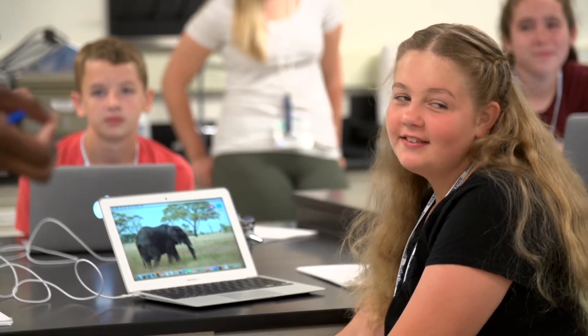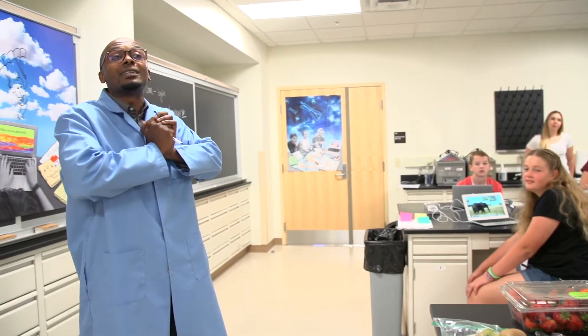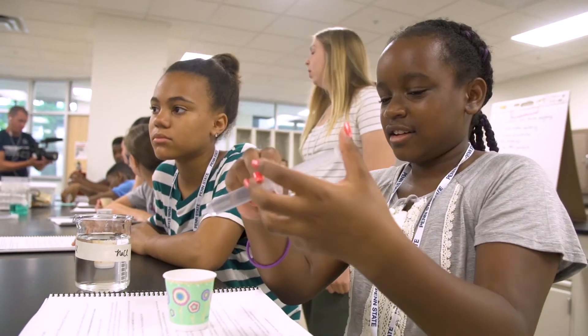It's actually not that hard. We're going to actually see it — we are going to see DNA. And not only are we going to see DNA, we're going to see yours. First, we had this little cup filled with salt water.